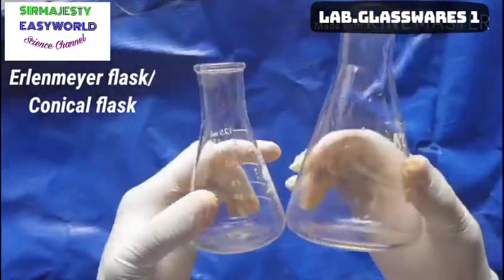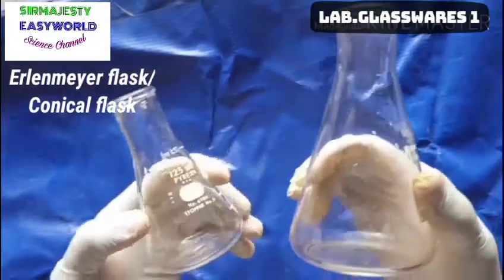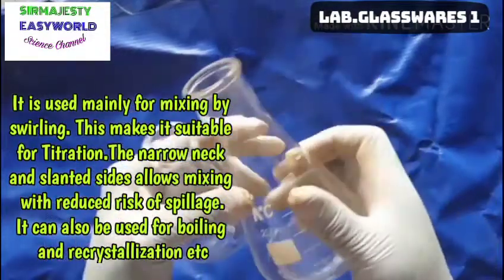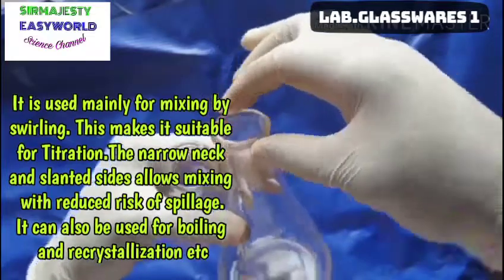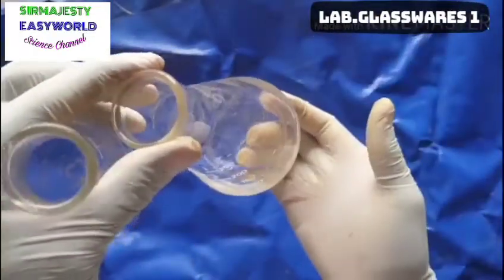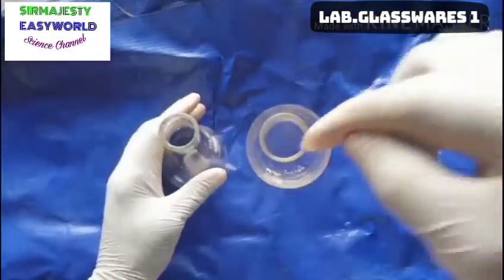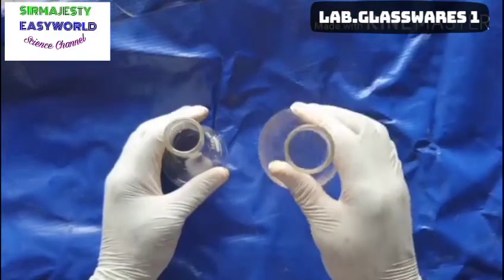These are Erlenmeyer flasks, named after Emil Erlenmeyer, who manufactured this design in 1860. They are also called conical flasks. The narrow mouth enables you to mix the contents well inside without the risk of spillage, so it can be used in titration where you're adding your acid into a measured base.